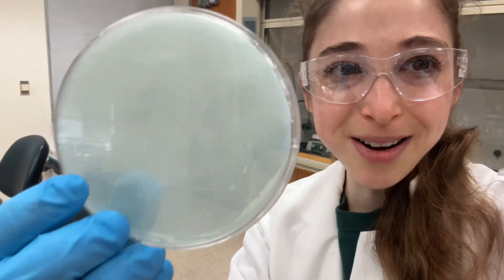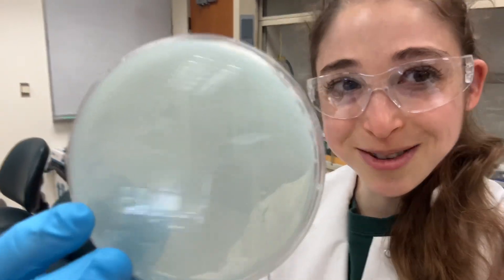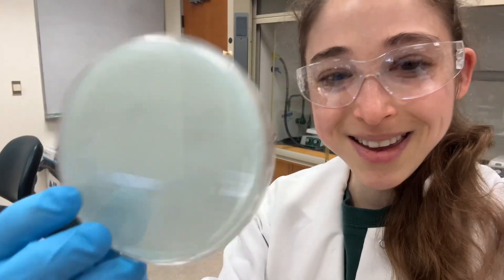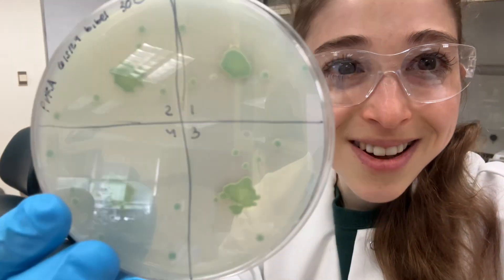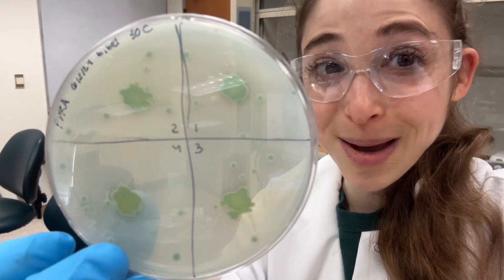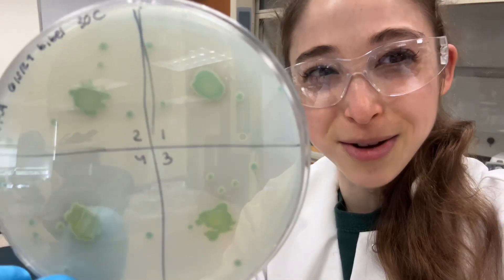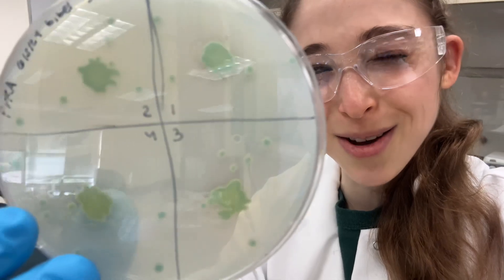As promised, here's an update on those blueberry bacterial pancakes I told you about the other day. Turns out they're not so blue anymore, at least not around the bacteria, and you can also see that clear zone — that halo.